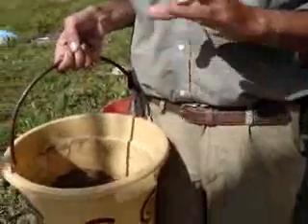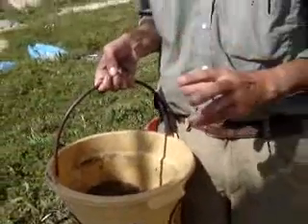One of the real advantages of the bucket flotation method is that you can have much more direct control over your recovery. You can actually see when there's still charcoal and charred material in the sample by the black specks that are there, and you can therefore repeat the process again until you get all of it out.